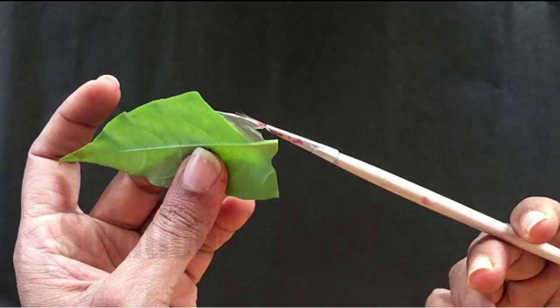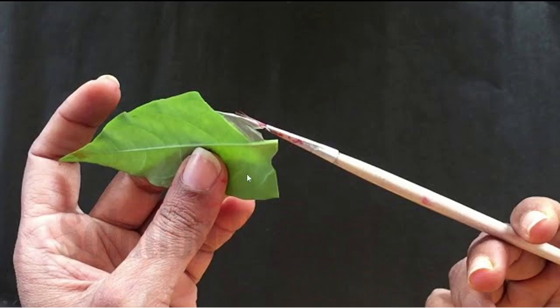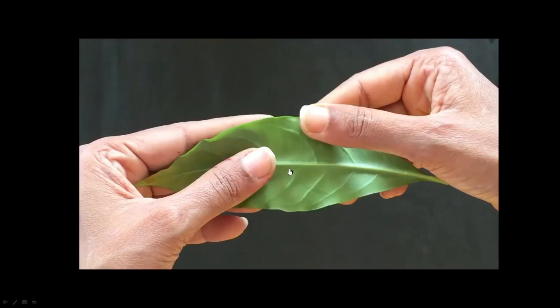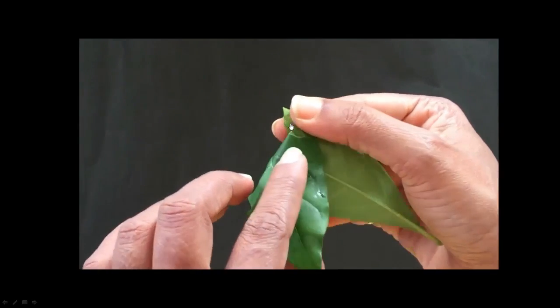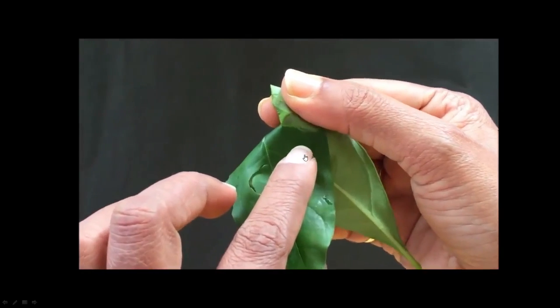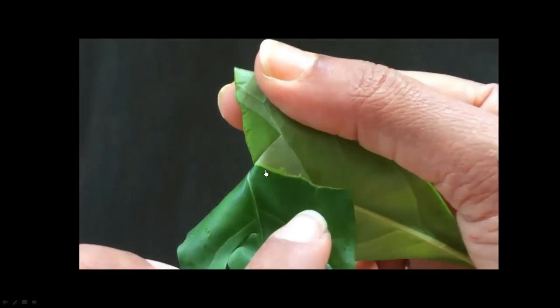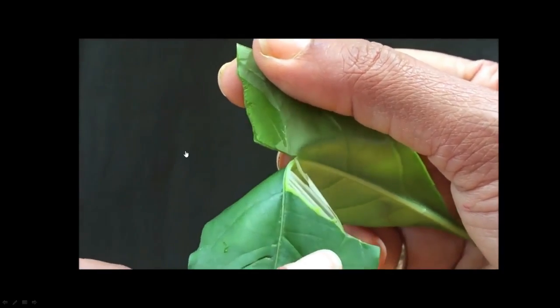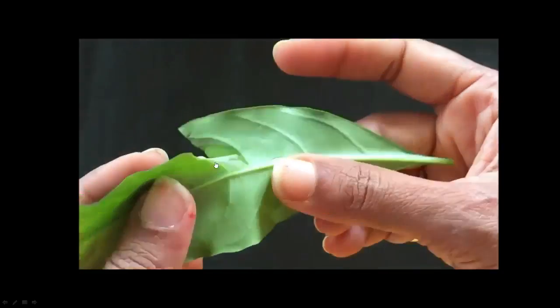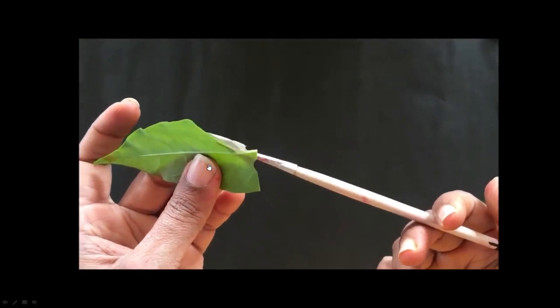I will send you a video showing how to prepare a slide of the leaf epidermis to view stomata, with commentary. Watch this video and see how the slide is prepared. Next time you come to the lab, you will get to practice this. Okay, thank you.